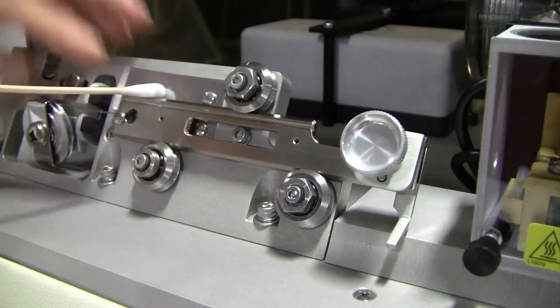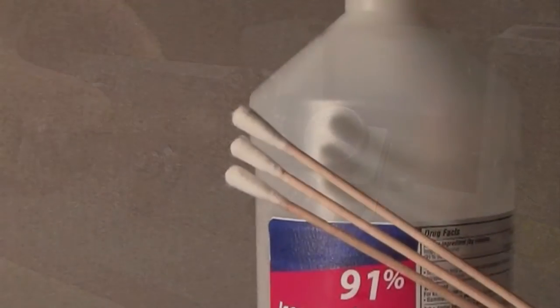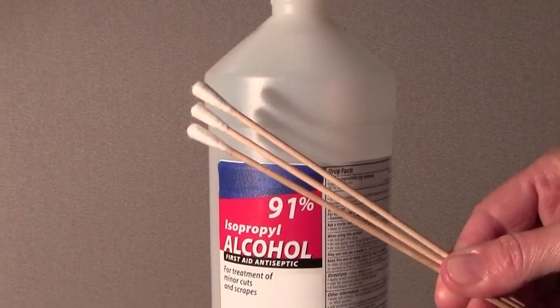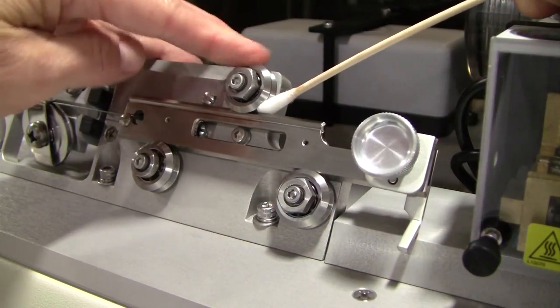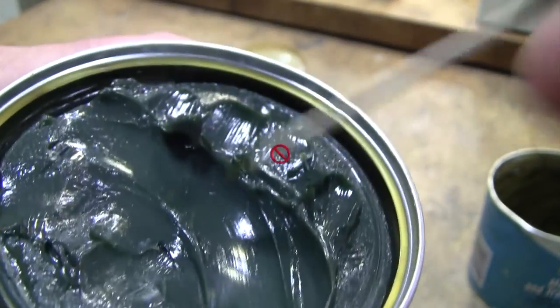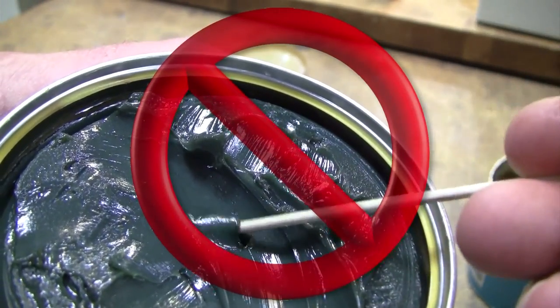It pays off to clean your puller bars and V-groove bearings from time to time. Use a cotton swab wetted with ethanol or isopropanol to remove dirt buildup from the V-grooves and their mating surfaces on the puller bars. Do not apply any lubricant to the surfaces or to any of the bearings on your puller.